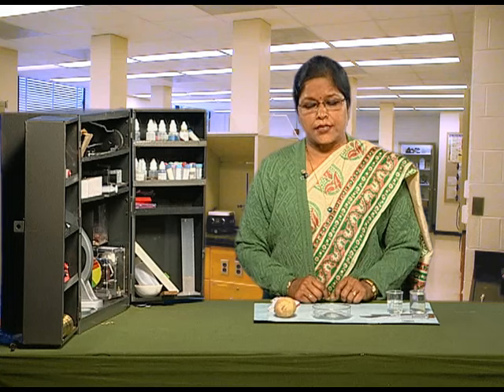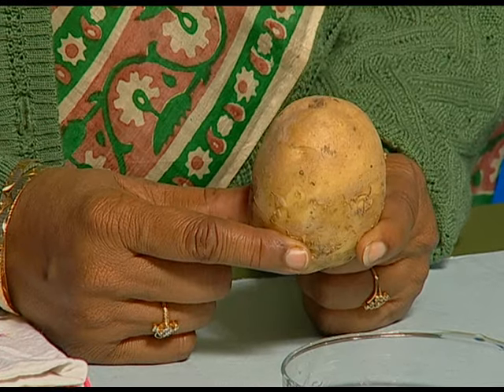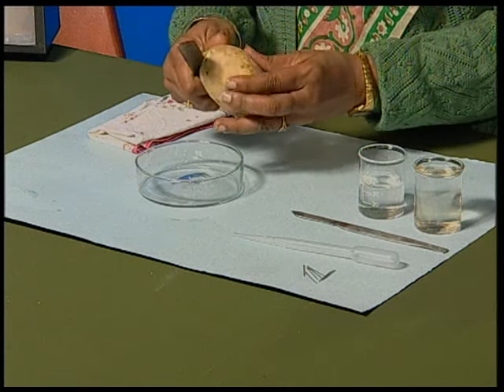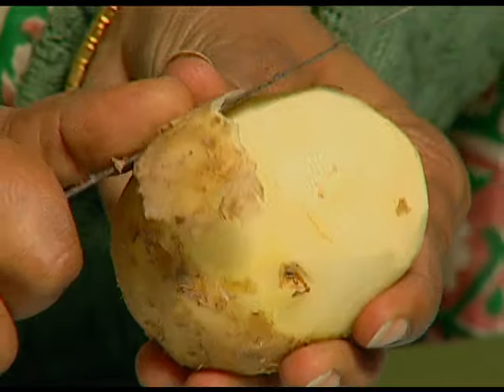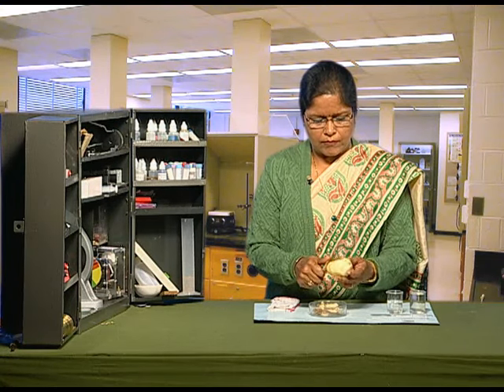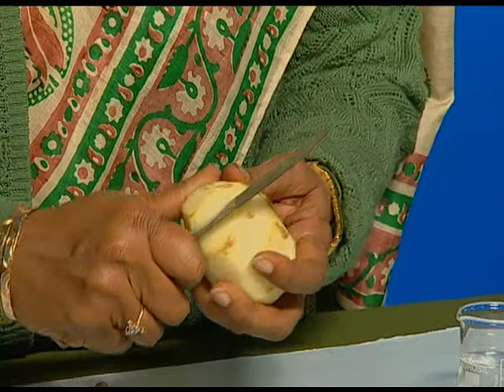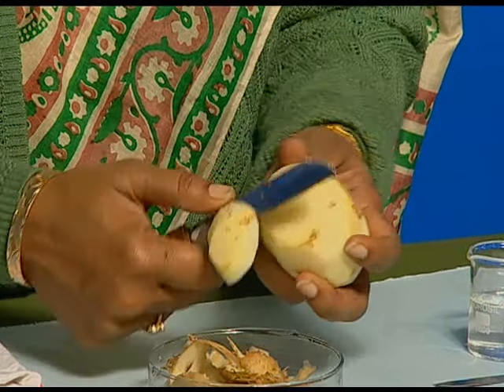To start this, first of all, we have to peel out this potato with the help of a knife. After peeling it fully, we will cut the ends of this potato to make the surfaces flat.